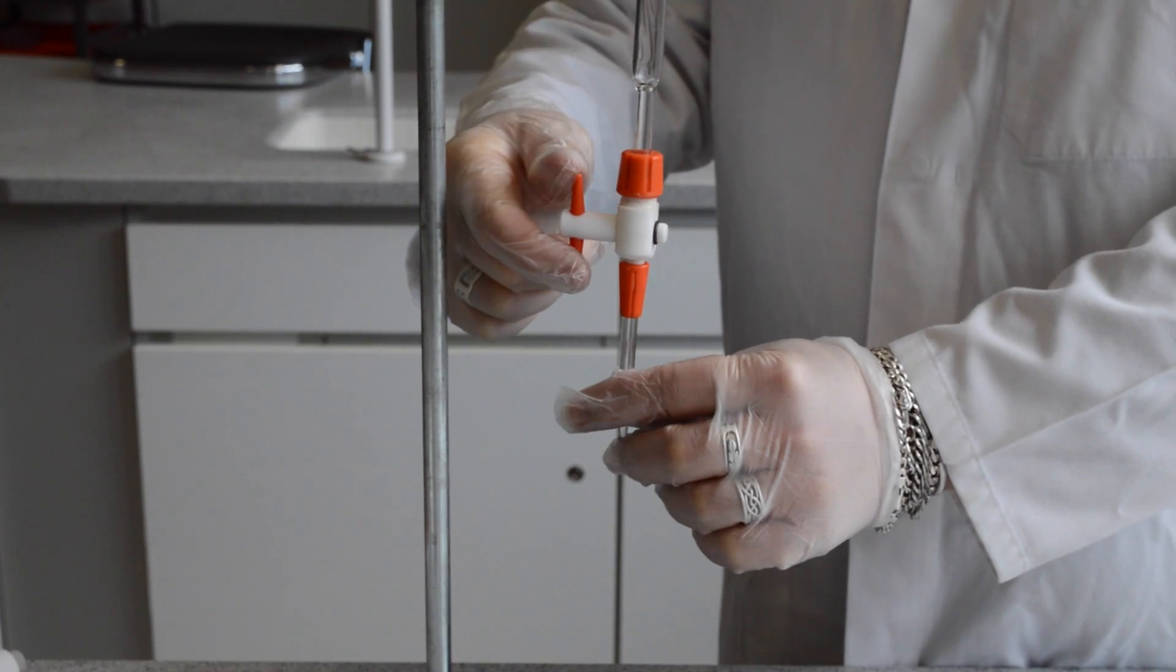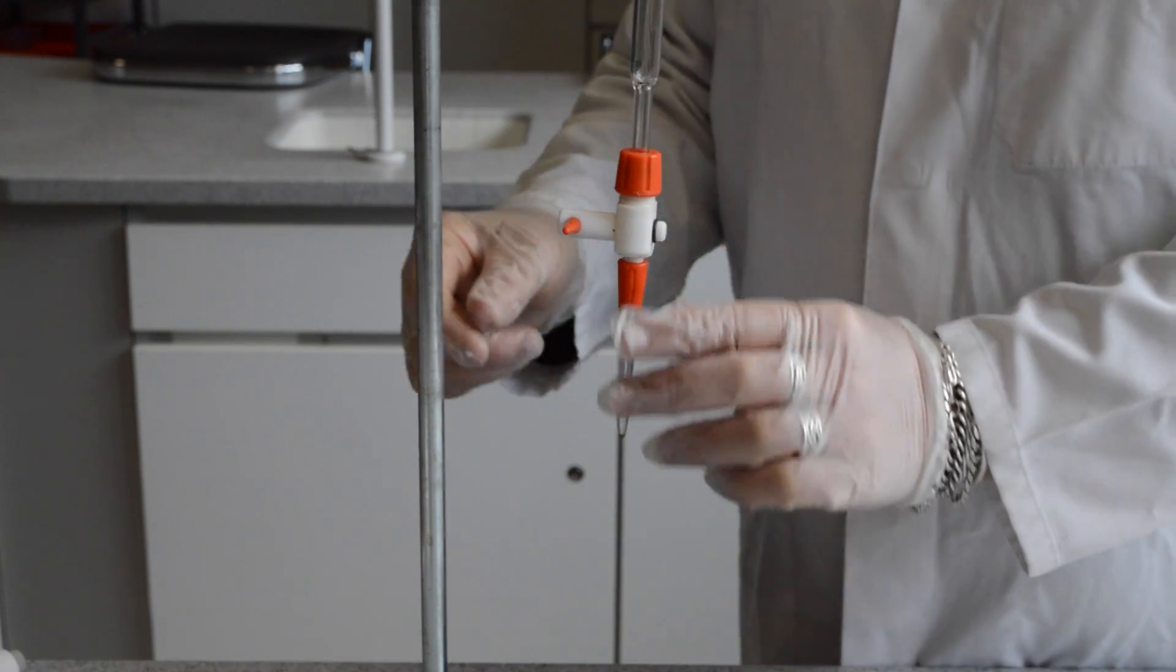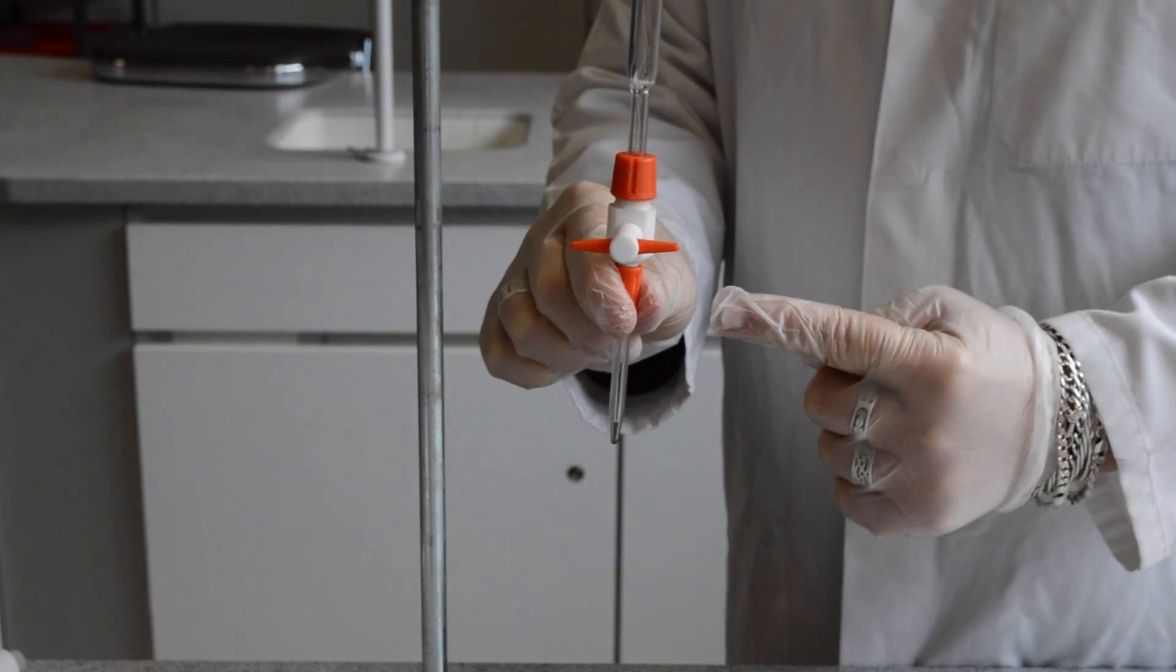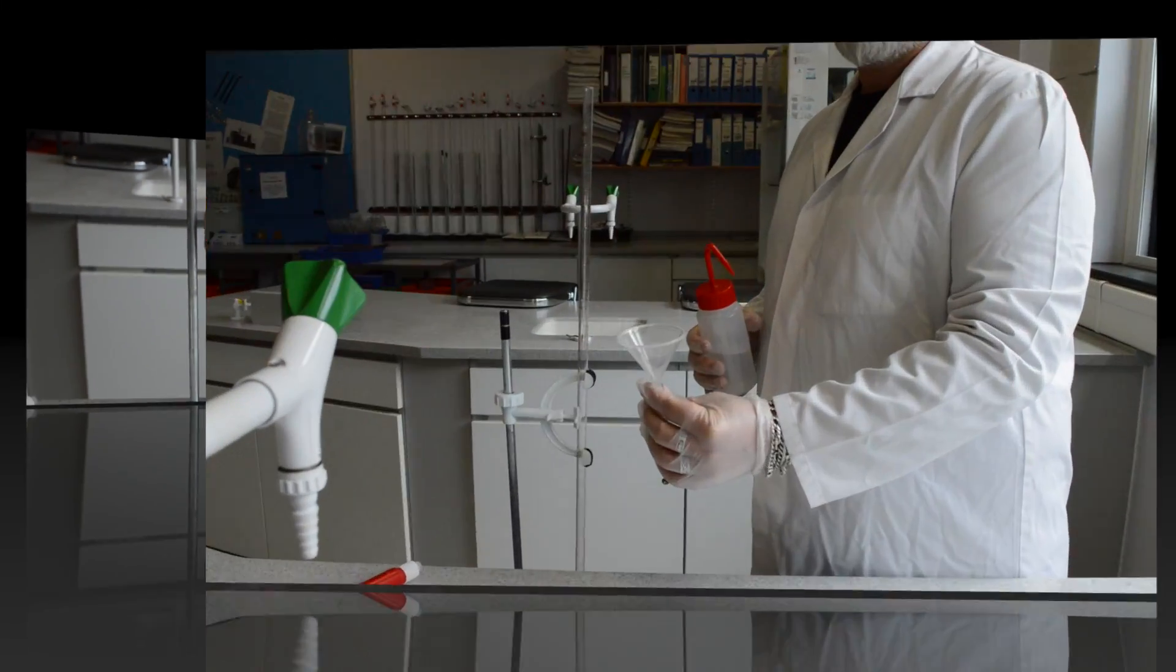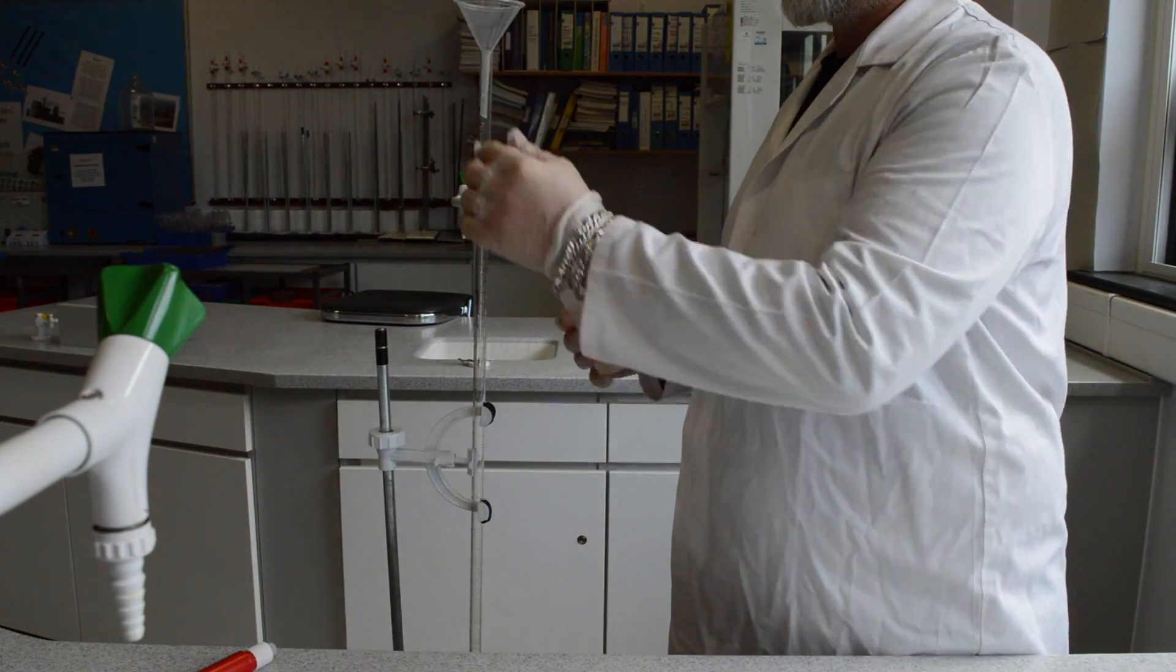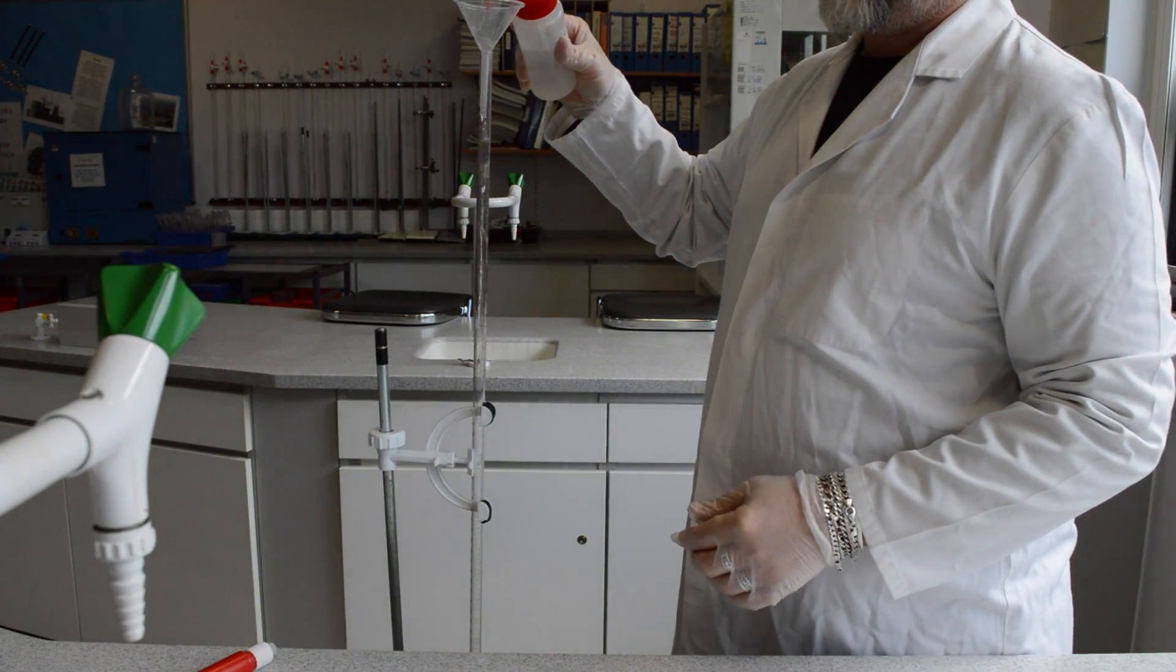Operating a burette tap. When the handle is across the burette or at right angles to the burette, it is closed. This enables you to fill up the burette with any substances that you require.